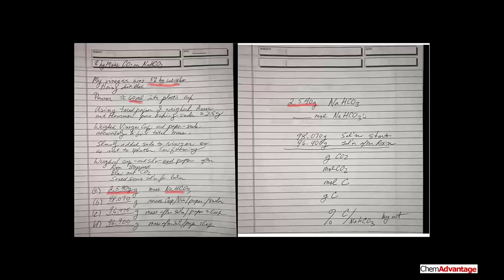All of it's going to end up reacting. Now back to our data, we had everything, our cup, paper, and you name it at the start of the experiment that we weighed here. That's our 98.07 grams of solution. And we added the baking soda carefully, and finally blew out the carbon dioxide.